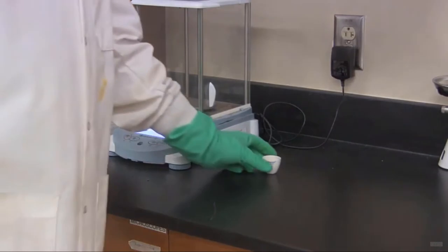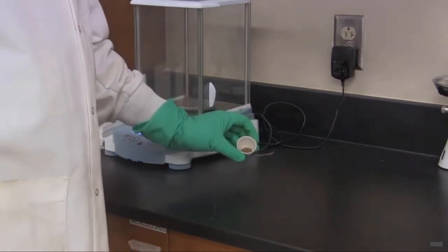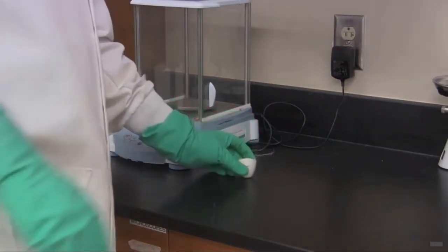So I've got my copper chloride sample here. It's been dehydrated. It's been sitting for 15 minutes. Now it's cool. And now I'm going to go ahead and weigh it.